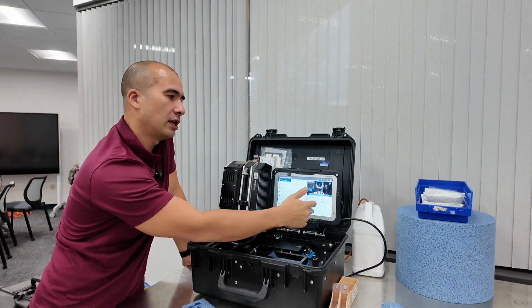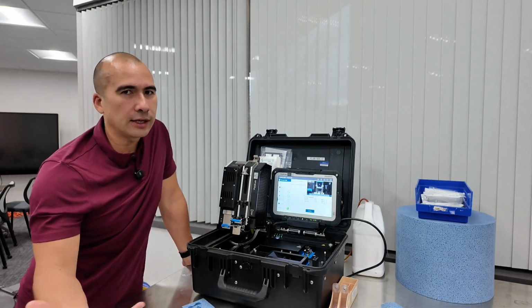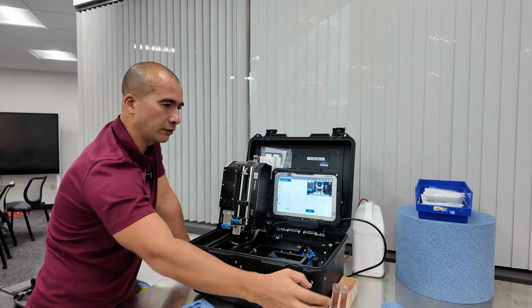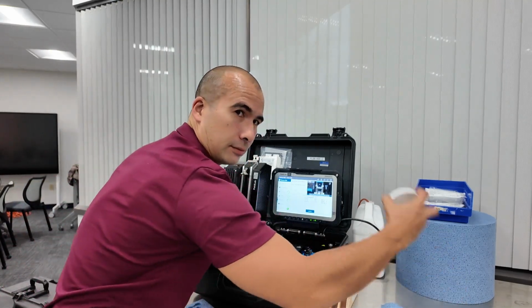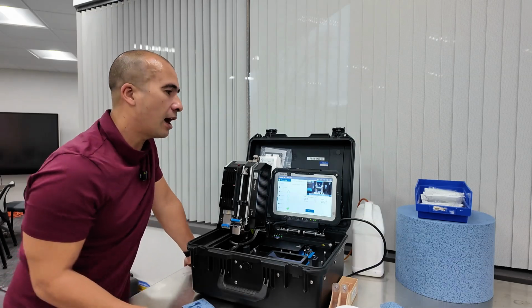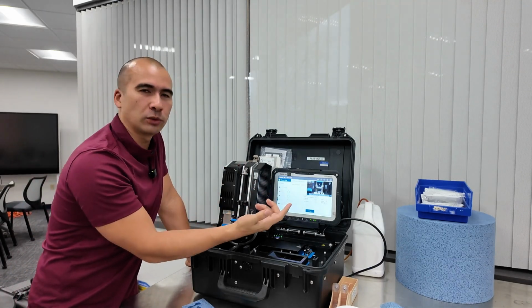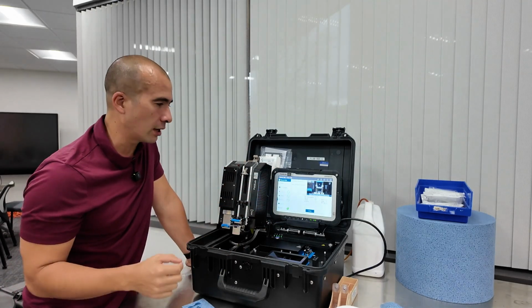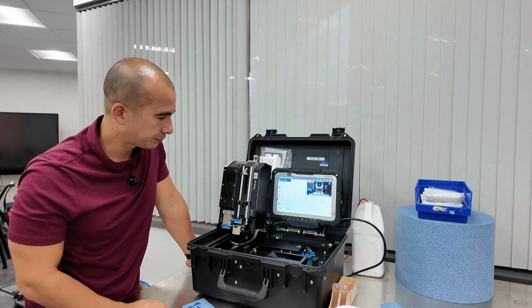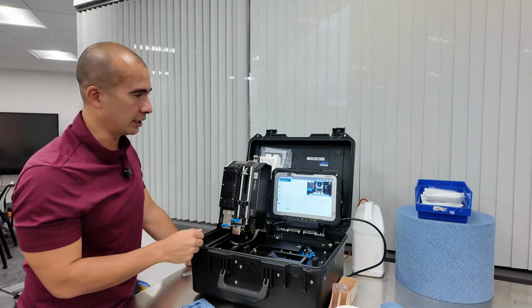So in this case, the particle count is a 20, 18, 15. Obviously, if you had an oil that was in use, it'll probably show up dirtier. This is relatively clean oil, although terrible me for sample hygiene. I should always be closing bottles. And it will actually give you the particle counts as well. So it'll give you the number of particles that was counted in the 4, the 6, and the 14 ranges. All right, so once that's done, you can press continue, and it will release the little filter here.